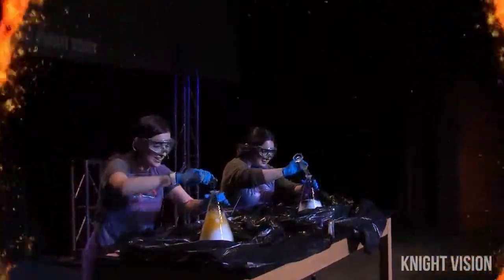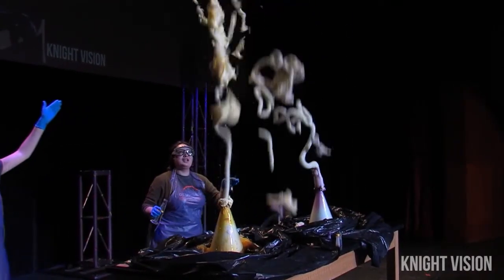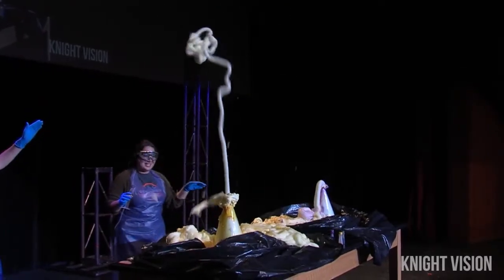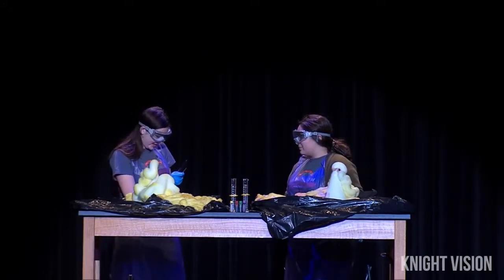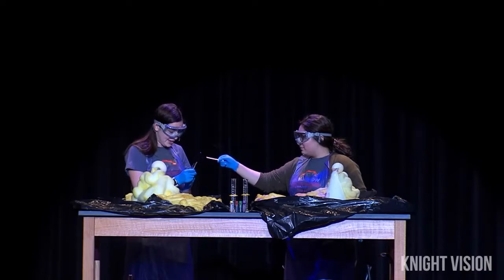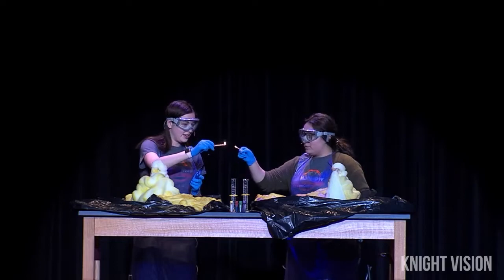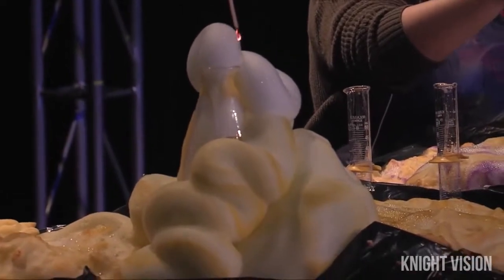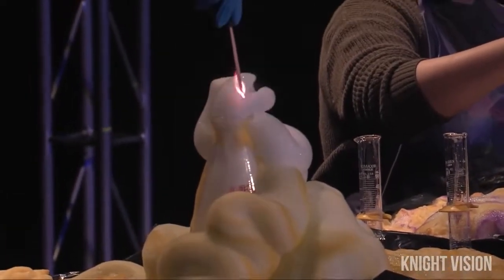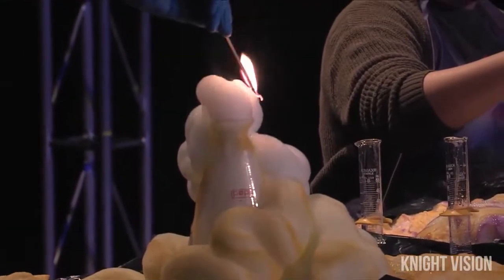Well, that was cool. I really wish that we had some fire in our reaction. I was thinking the same thing. So we have these matchsticks here and we're going to light them. We're going to light these matches. So since this reaction produced a lot of oxygen, I can blow it out and reignite the flame on our oxygen reaction here. Alright, that was great.